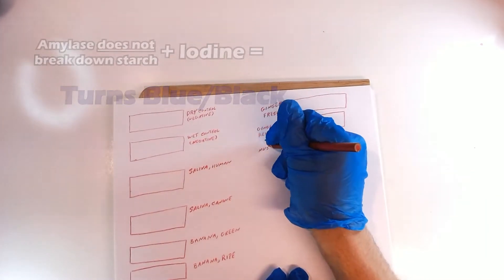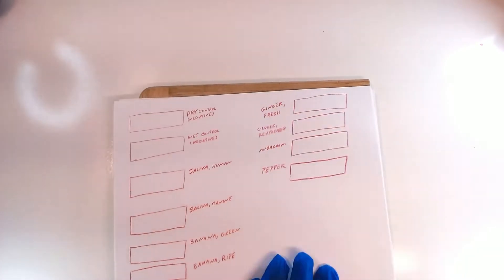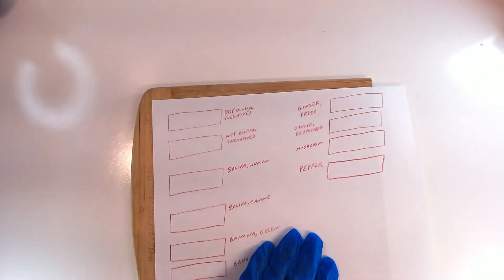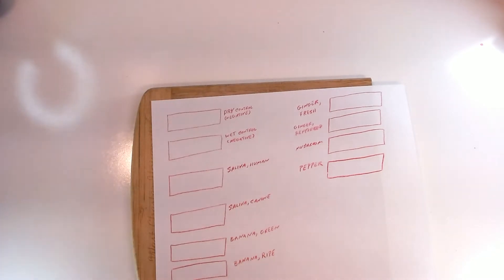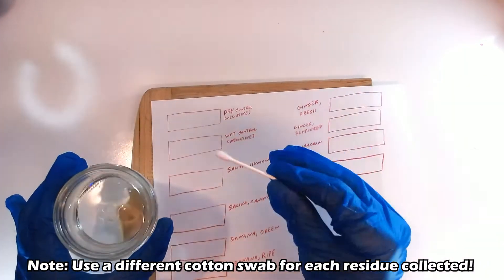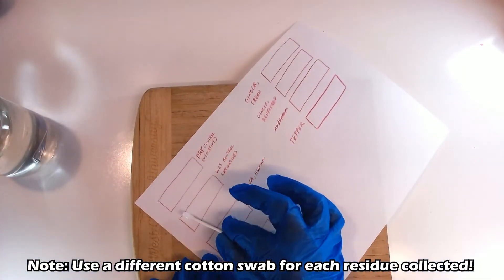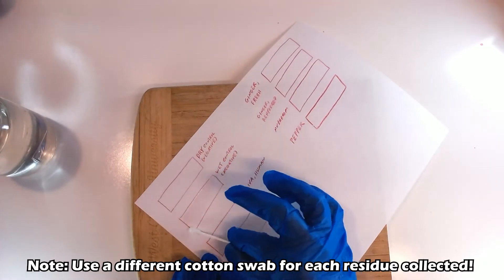To set up this experiment I'm going to take my piece of computer paper, draw some rectangles on it, and label each one for the substance that I'm going to place inside of that rectangle. I have two negative controls: dry and wet. Dry I'm just going to leave entirely alone; wet I'm going to put pure water, just tap water really. I'm also going to test two different types of saliva — human and canine saliva.